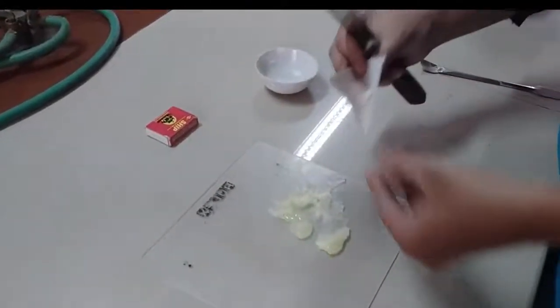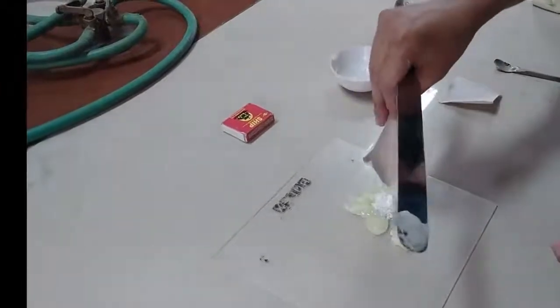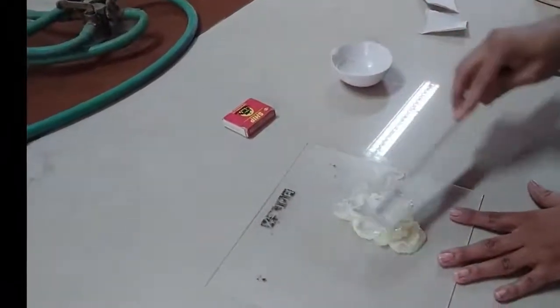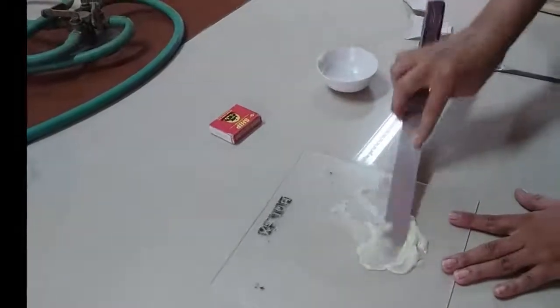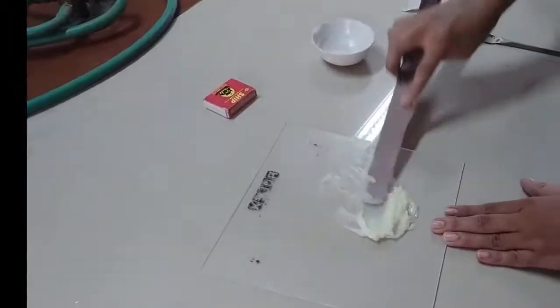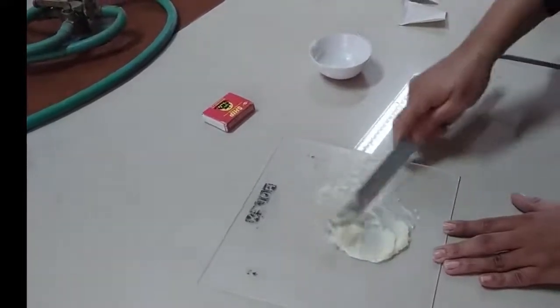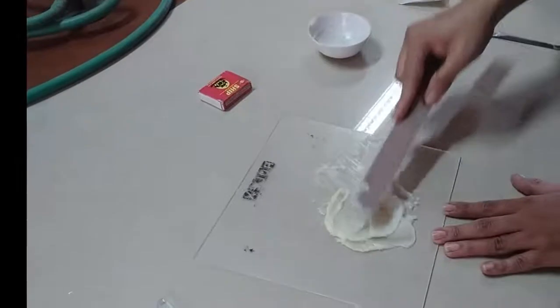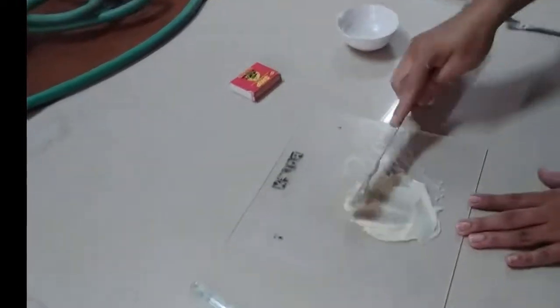Now we will add salicylic acid and benzoic acid. We have passed the salicylic acid and benzoic acid powder through a sieve in order to prevent large size particles. Now we will levigate it with the help of a spatula and allow it to mix uniformly. This process of mixing is known as levigation, where you incorporate the API into the base. Care has to be taken that there should not be any particles remaining as such. All the drug particles should get equally incorporated into the emulsifying base.